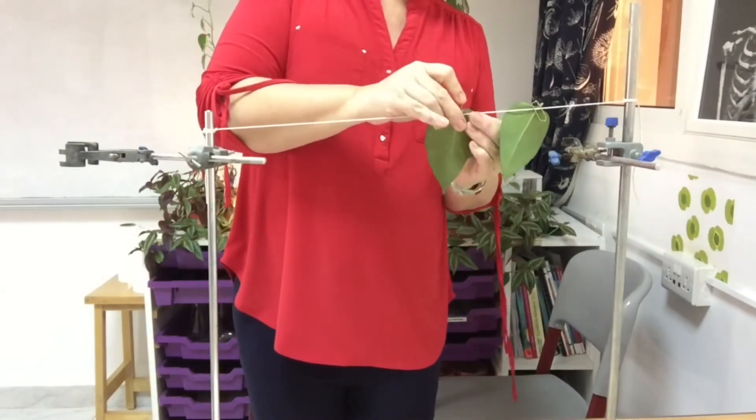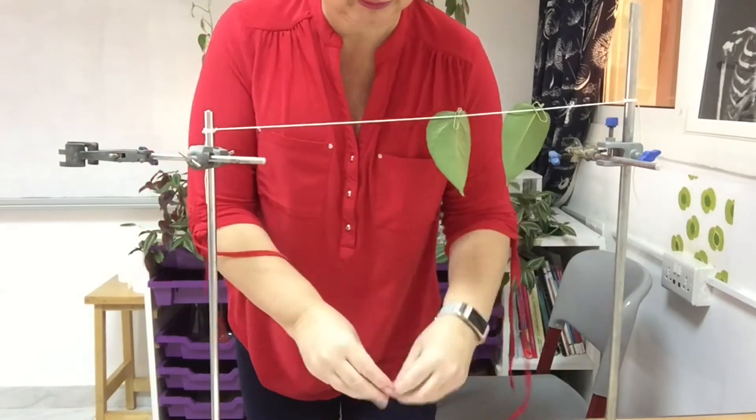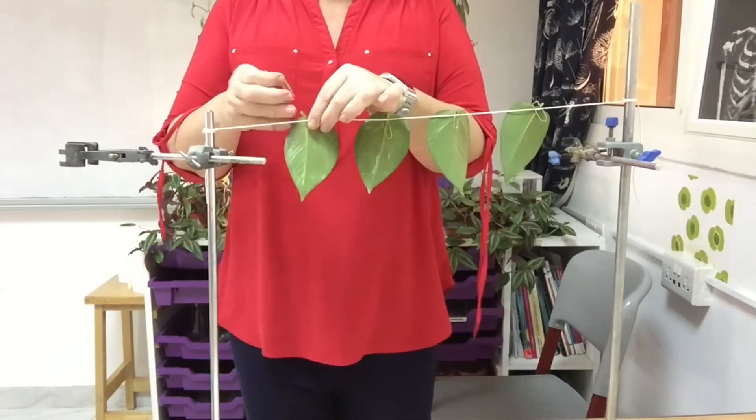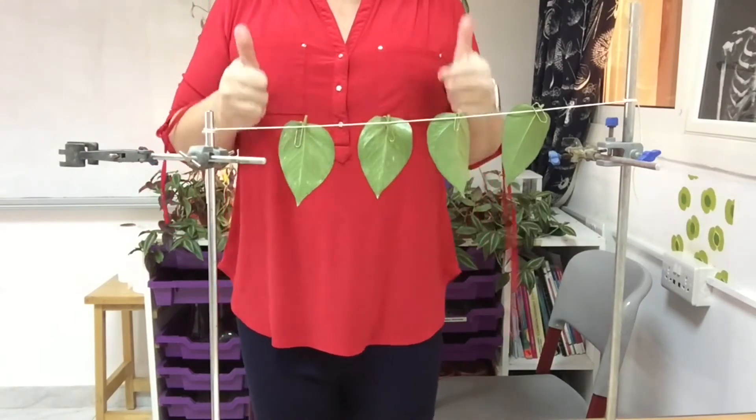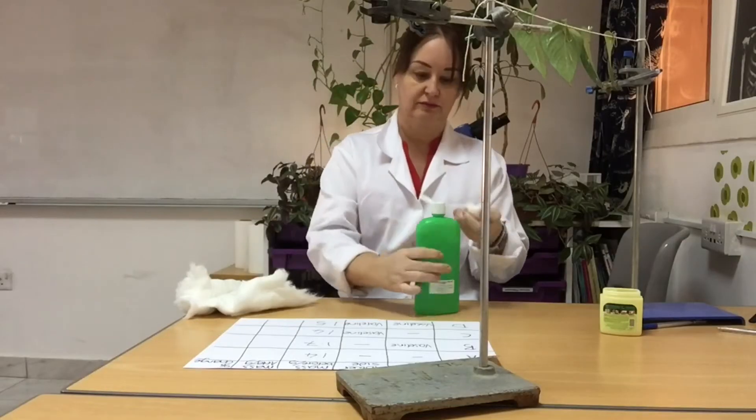When that's done, I'm going to record the area I'm leaving them in. What I mean by that is: are you leaving them in an area with lots of airflow, or in an area that's still but warm? What are the conditions you're leaving your leaves in?